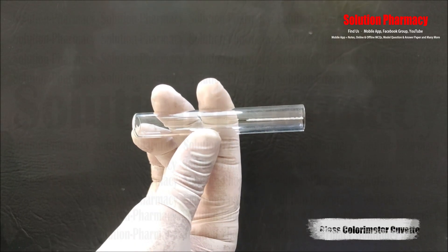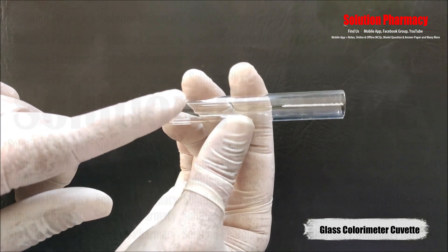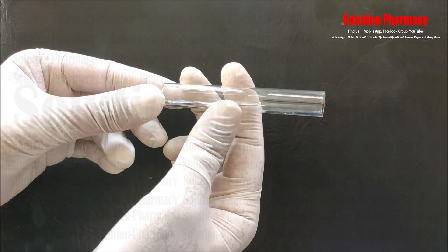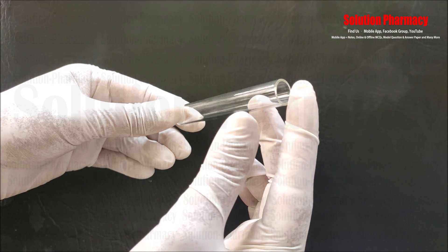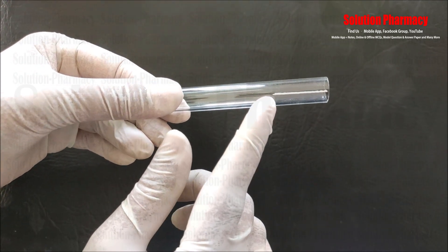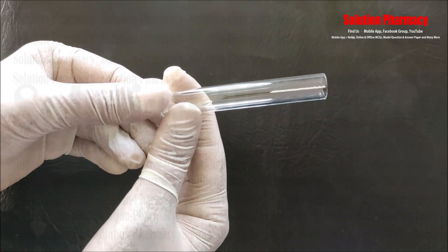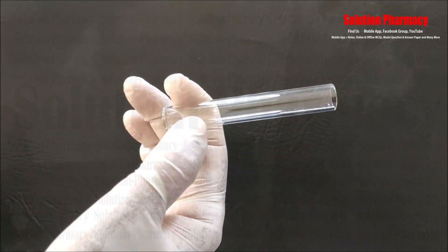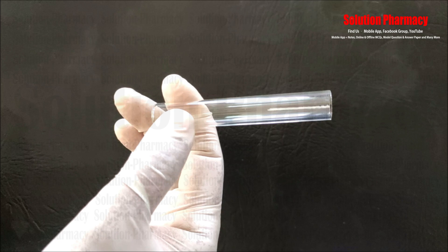Next, this is called a glass cuvette. As you can see, it is like a small test tube with a flat bottom — it is a colorimeter glass cuvette in which we fill the sample for spectroscopic measurement. There is a white line marking, and according to this marking we have to place and set the cuvette inside the sample holder of the colorimeter.